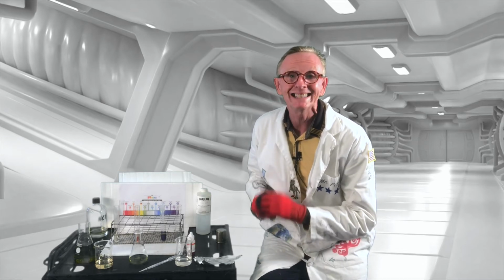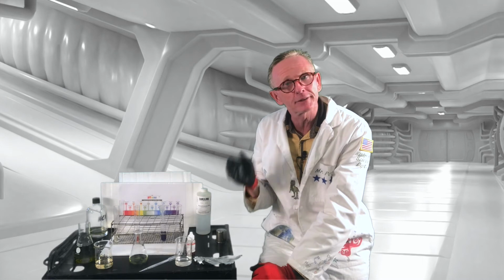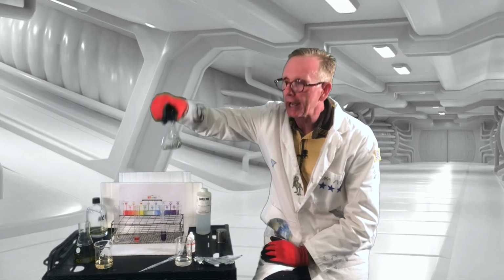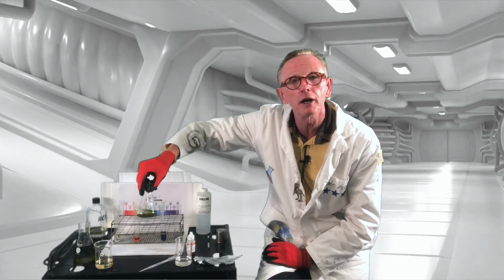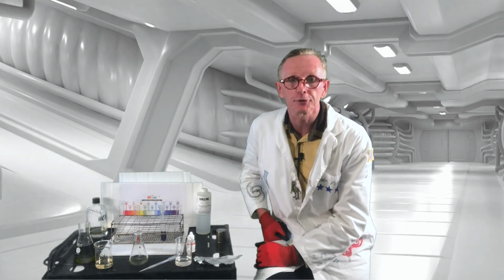Now, what next? Obviously, we're trying to show what could happen if we're talking about a hazardous waste, if we mix this chemical with this. Of course, if it's an acid, a known acid, and a known base, we can neutralize them. Now I have something that is actually non-toxic that can be disposed of safely. If you can't think of something else, another experiment you would like to try, big scale. How might we try this on an industrial scale?